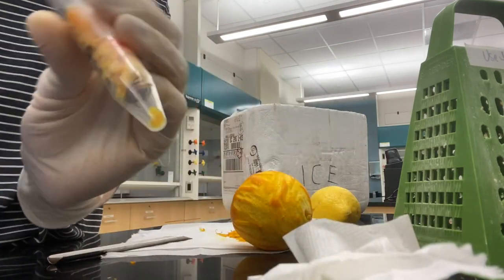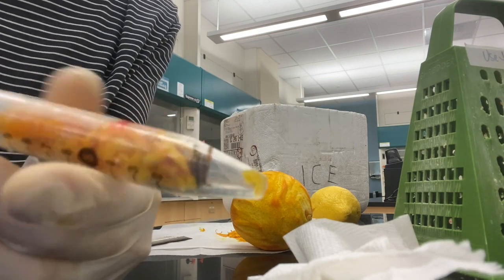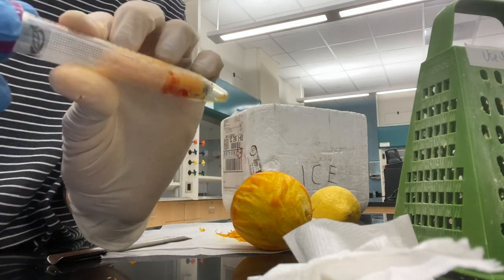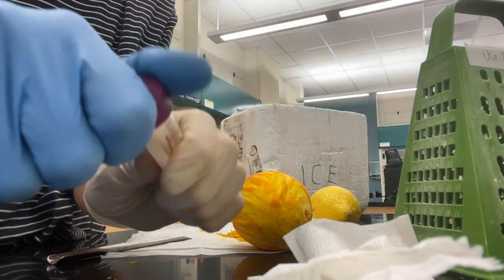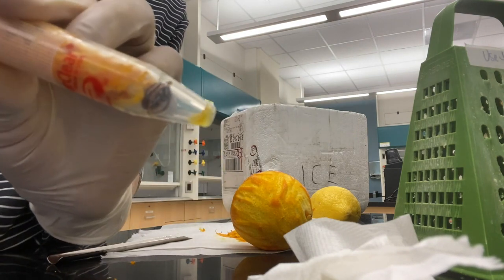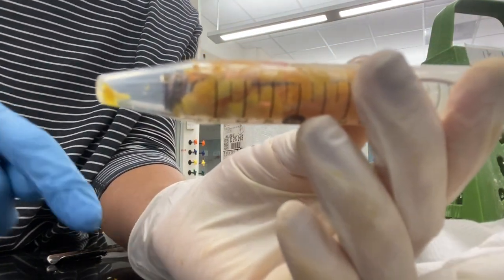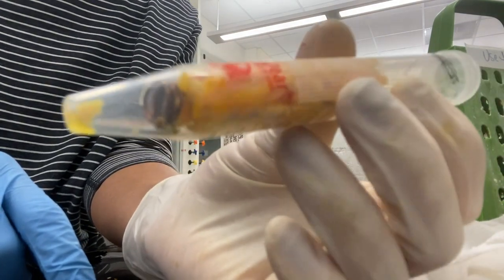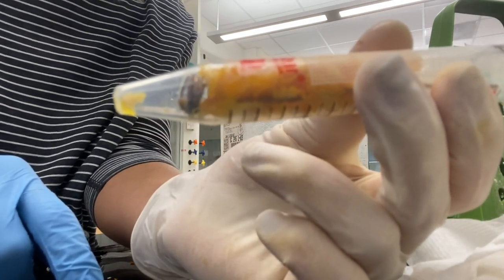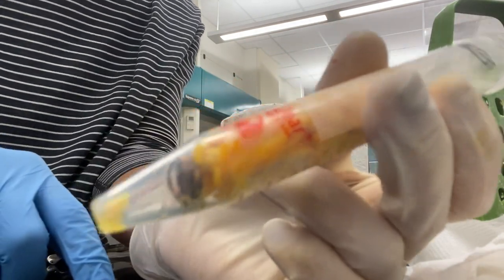After each extraction you'll notice that because this had a lot of pressure in it, when you release the cap and unscrew this, you'll notice that little hiss. That will be indicative that we still got pressure we need to release from it. You can see down here that we do now have some oil. It's mixed in with that solid piece that you can see. It's not super clear, but we do have some nice oil at the bottom and it's very fragrant.